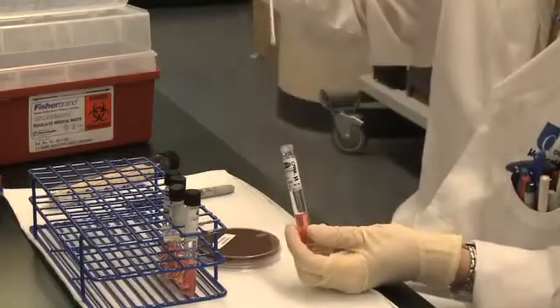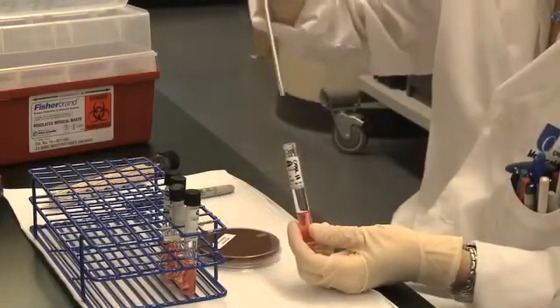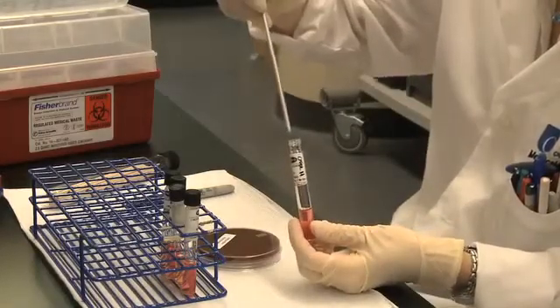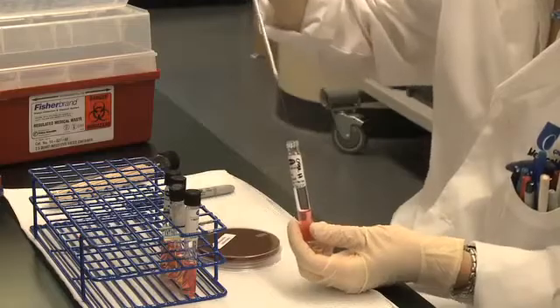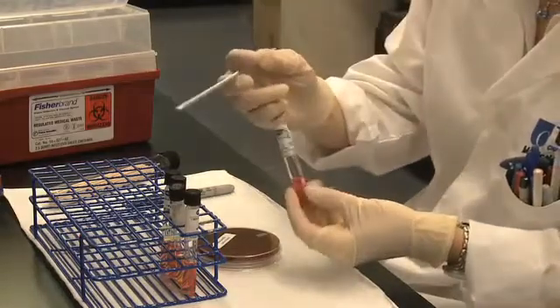Incubate the inoculated tubes at 35 degrees Celsius in ambient air.